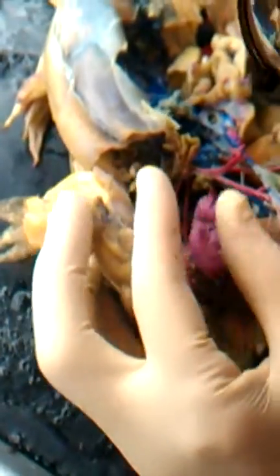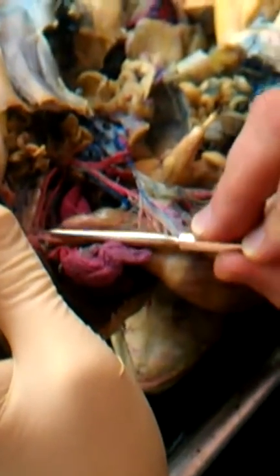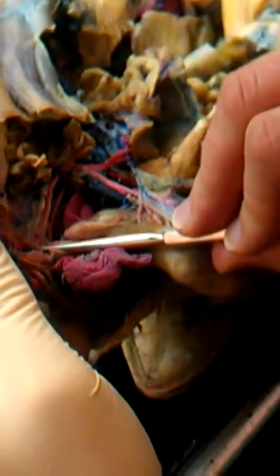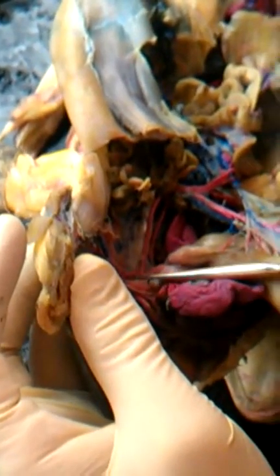Okay, and then that finally leaves now the main systemic arch right here. We'll continue with the systemic arch. And let me manipulate this just for a moment. Okay, if we move this around, we see these 2 branches here are the systemic arches, left and right systemic arches. And we're going to take a look at some vessels leading off the systemic arch. There's one way down here that you can see I'm lifting up, and it continues on up this way, this red one. It is a subclavian artery.